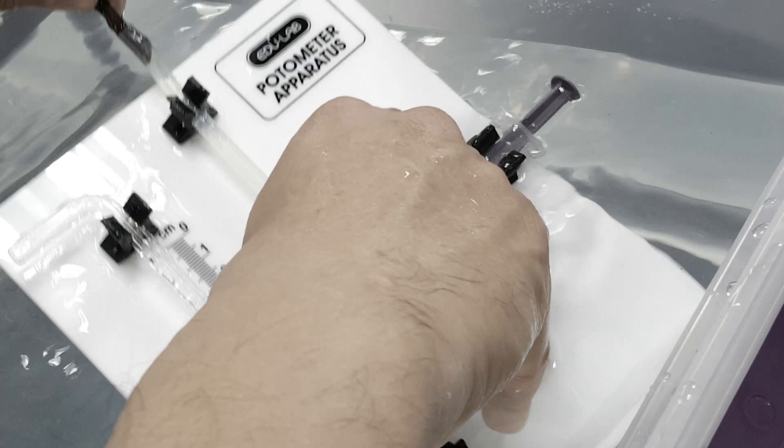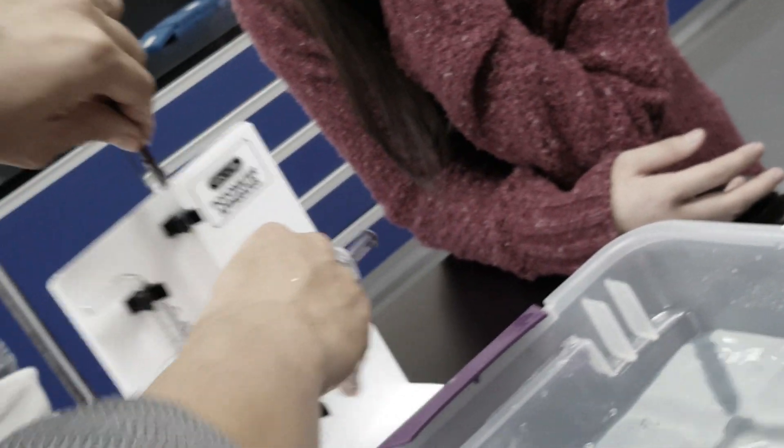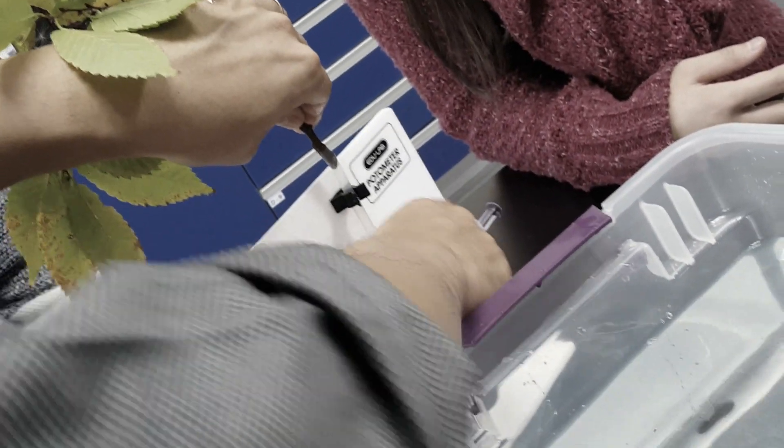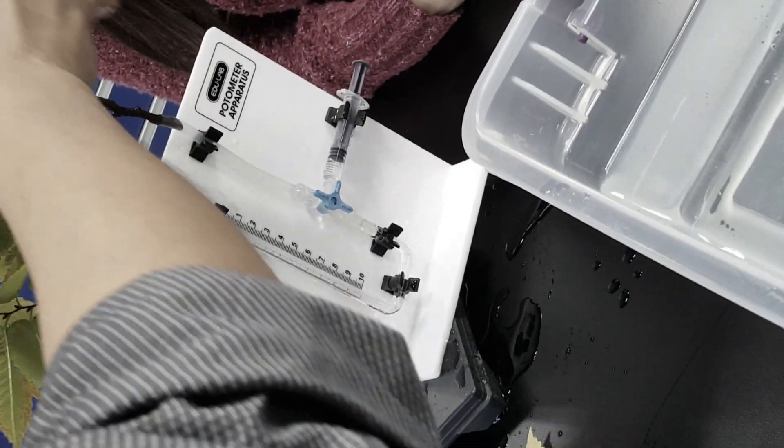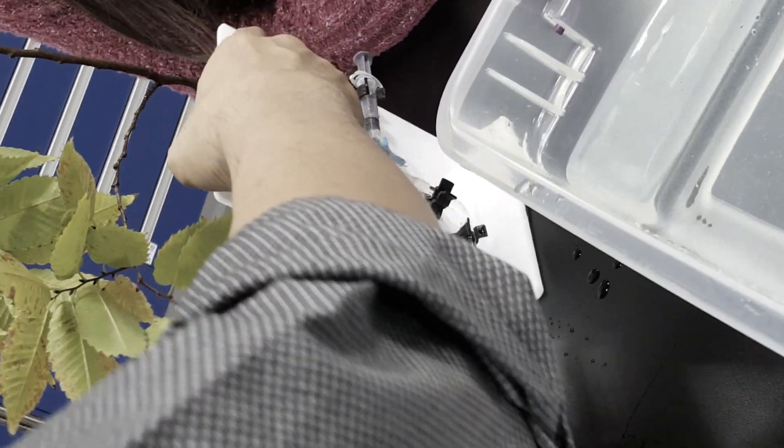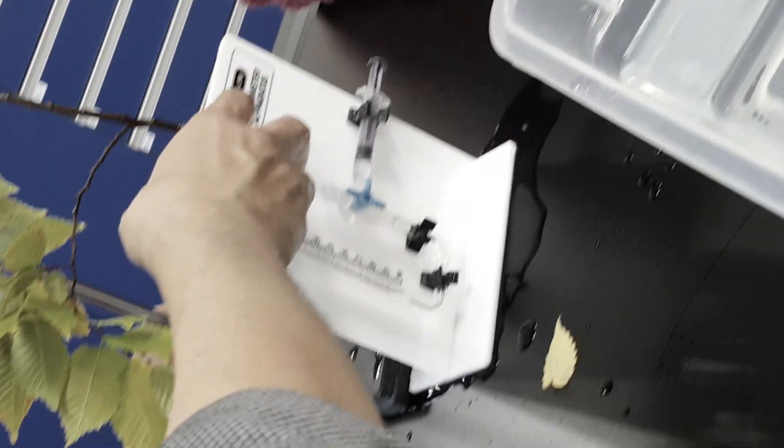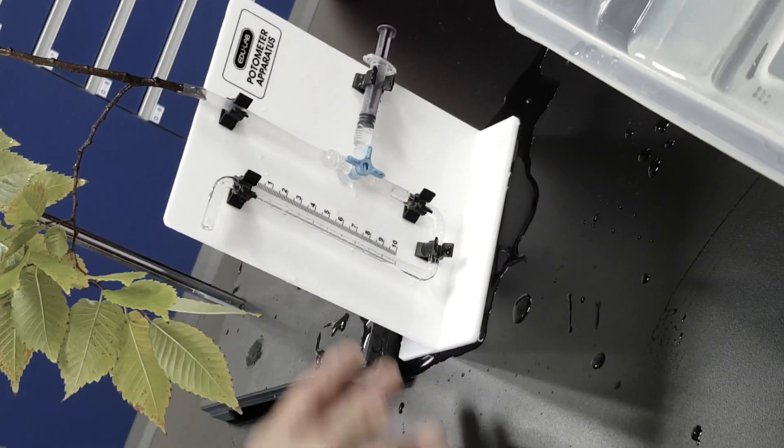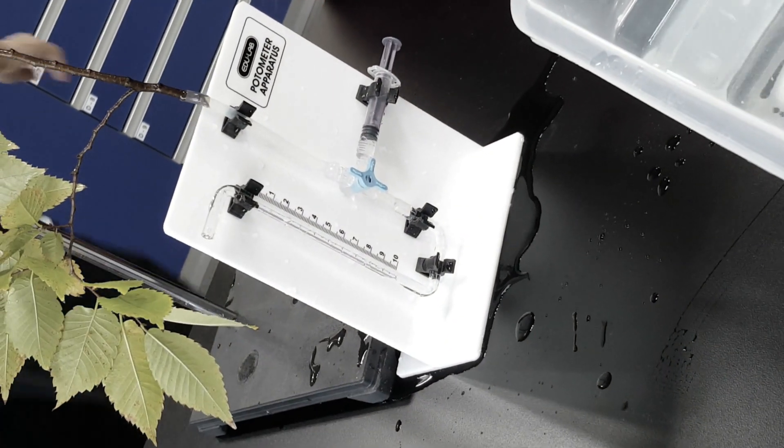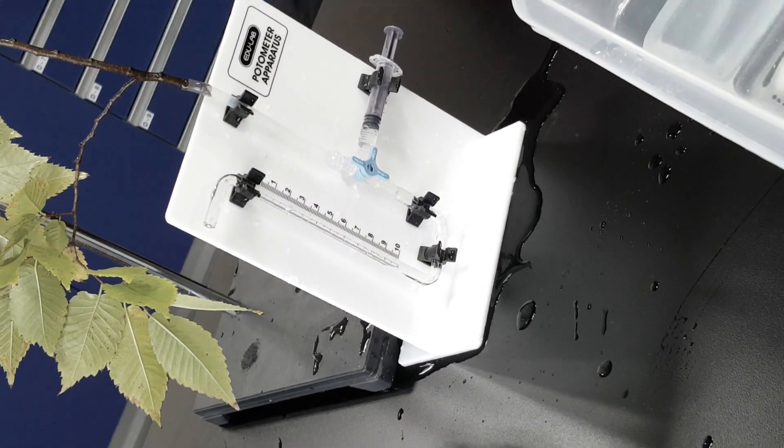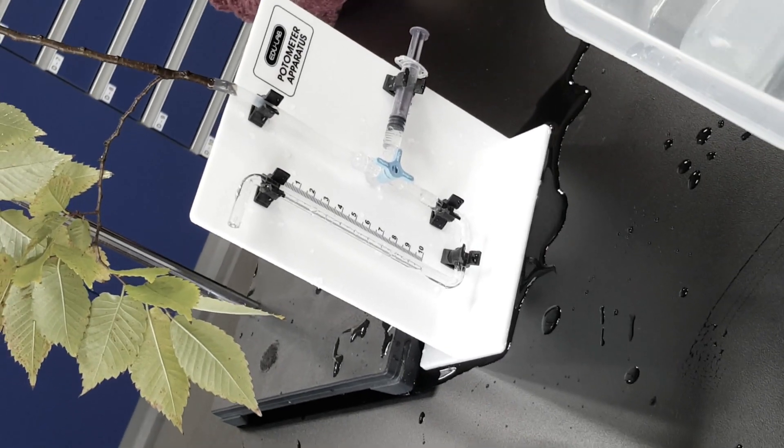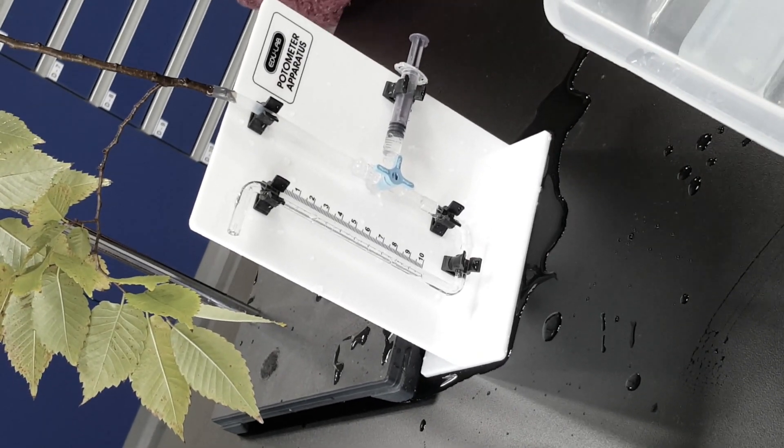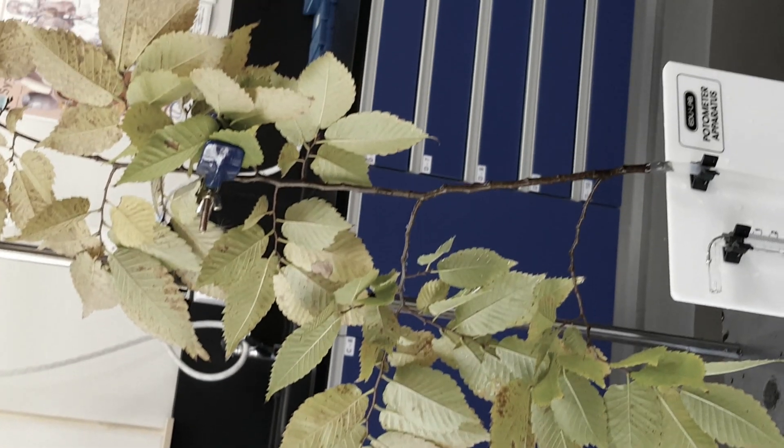And then you take this whole thing out and you set it on a stand, like this, so that you're having this thing keep the branches upright. Now the towel—Alex, are you filming that section over there? Yeah, I think so.